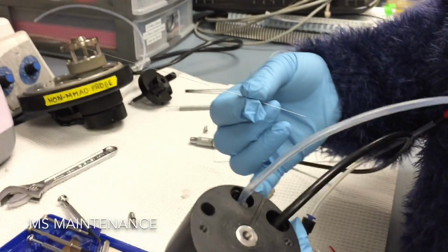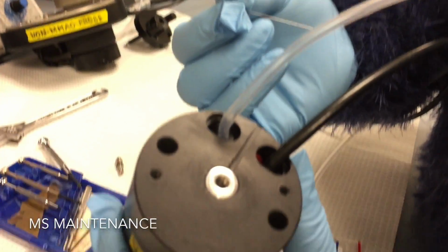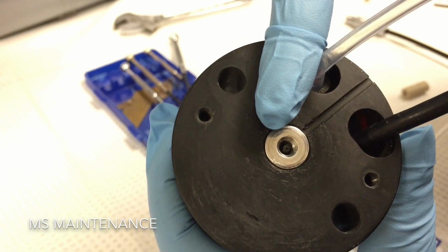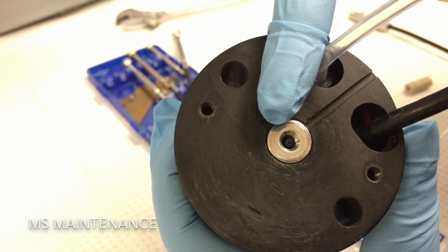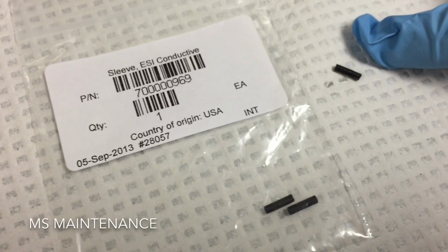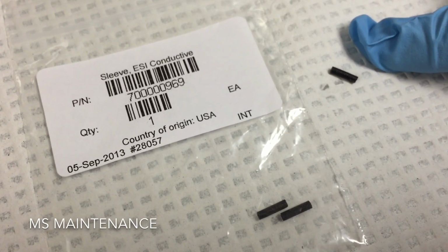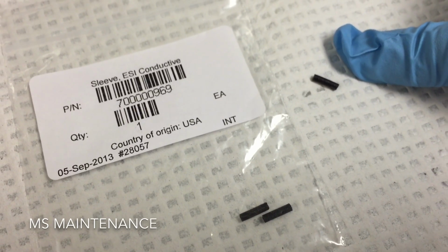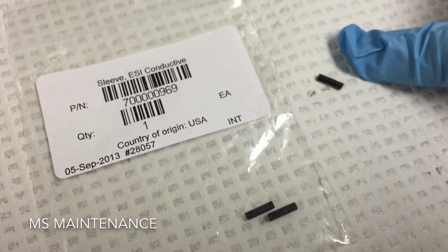So next you want to insert it into the probe, and inside the probe, as you can see right in there, there is a conductive sleeve with a really small hole, which is the same as this conductive sleeve over here. It's just a piece of foam with some polymer that allows the electrochemistry to take place when ionization occurs.